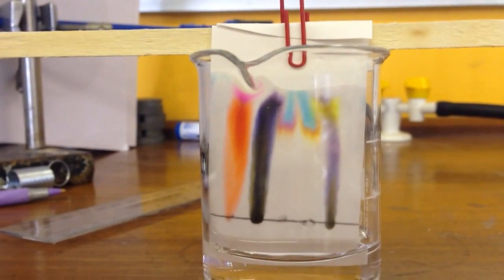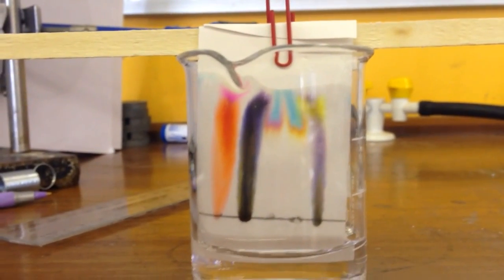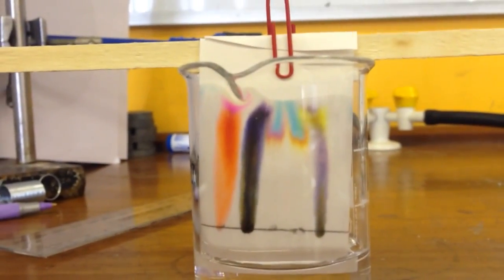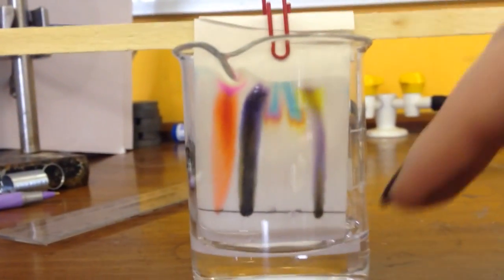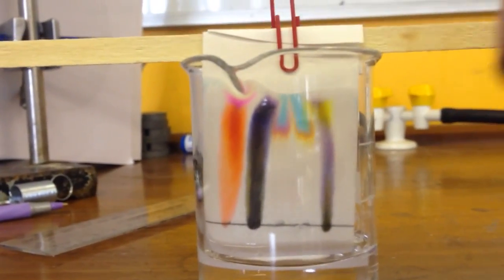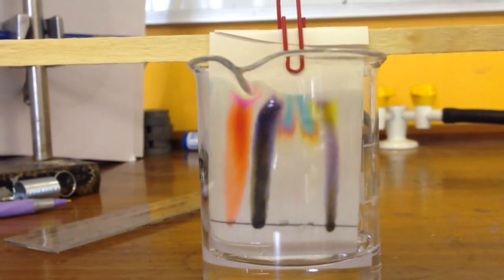Our chromatography has reached the water line, reached the top. And we can see that it's all spread out into some really quite pretty colors. I do like this experiment. It's very, very pretty.